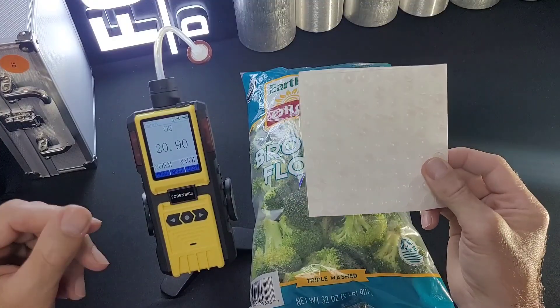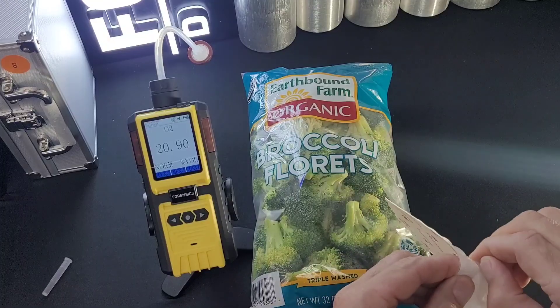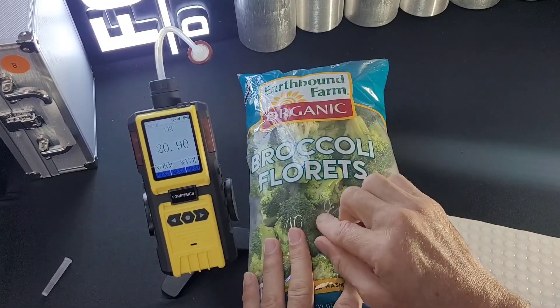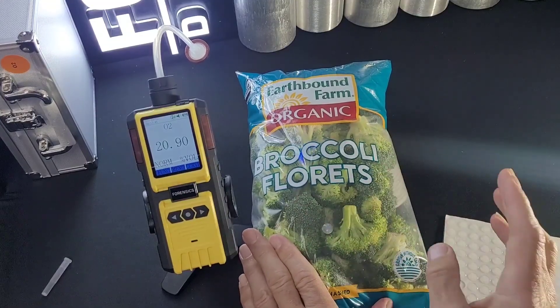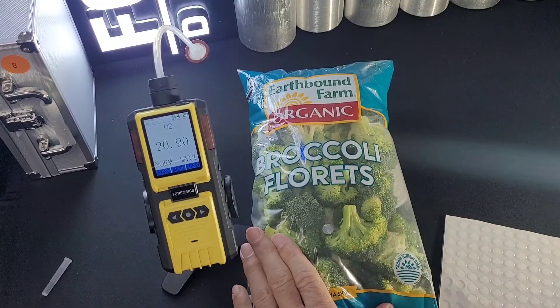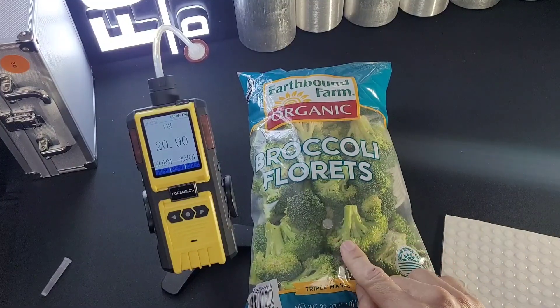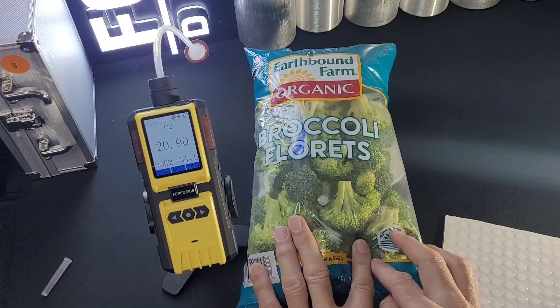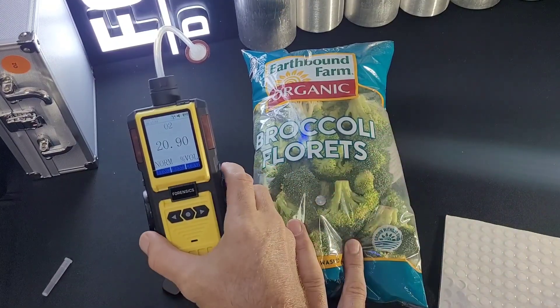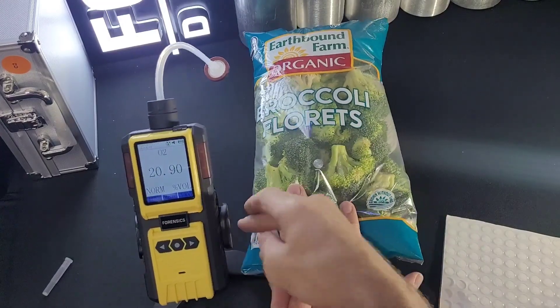You would have received some septum. Take one off carefully and place it on your food packaging. Obviously, you don't want to take a sample next to the food. Make sure it's somewhere in the middle, in a corner, or somewhere safe where no food will intercept the needle when you insert it. I like to come in on an angle.